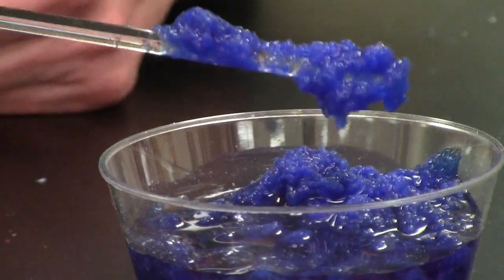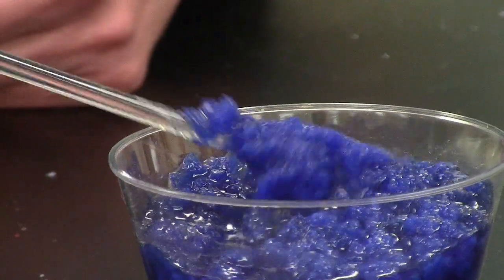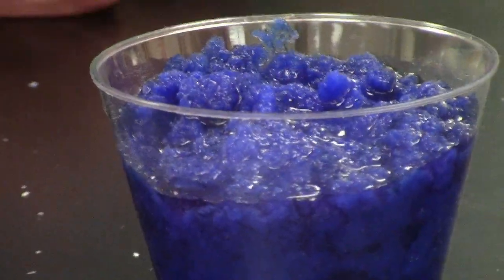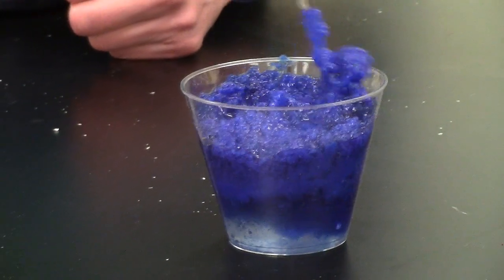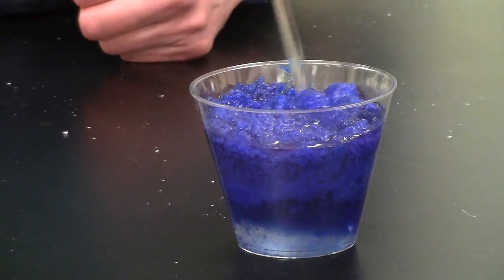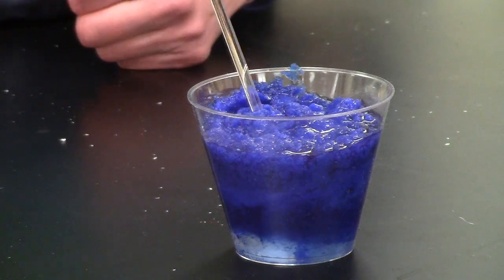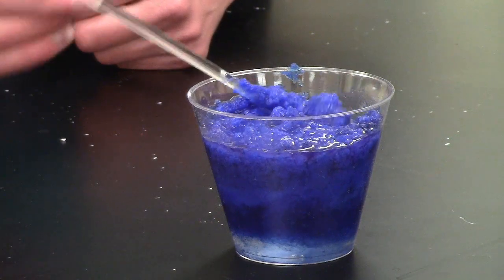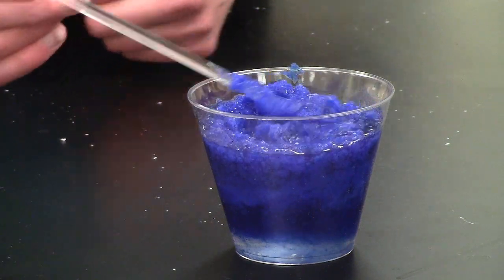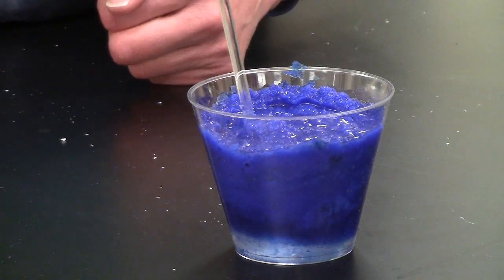Remember what a precipitate is. A precipitate is a solid that forms in a chemical reaction. So we're making something that is not soluble in water anymore. And so what we've got as our products, there's actually two of them. One of them is called cobalt(II) silicate, and that's that really pretty blue chunky solid that you see created in there. And the other one is merely sodium chloride.